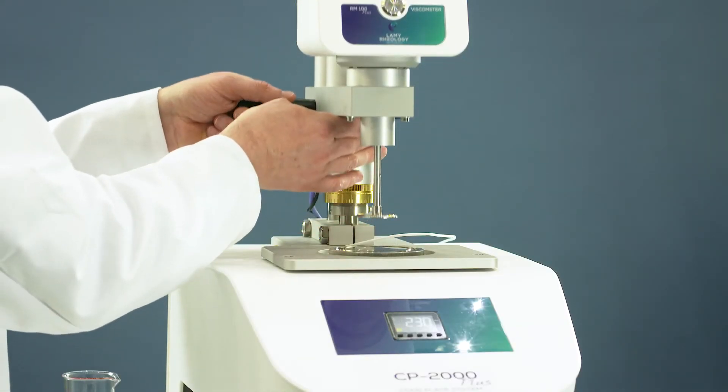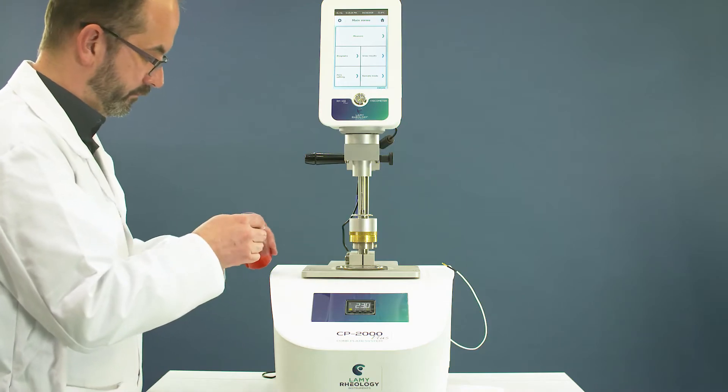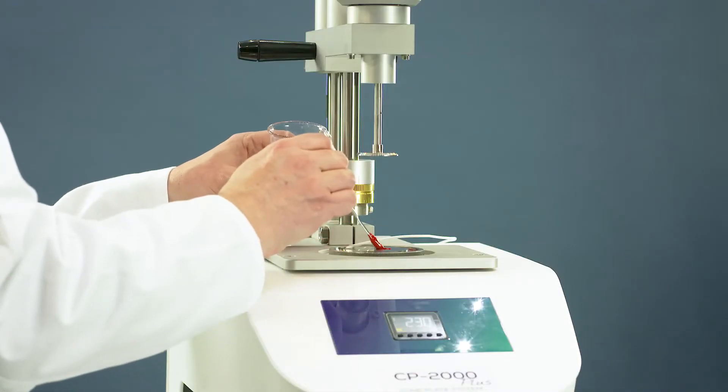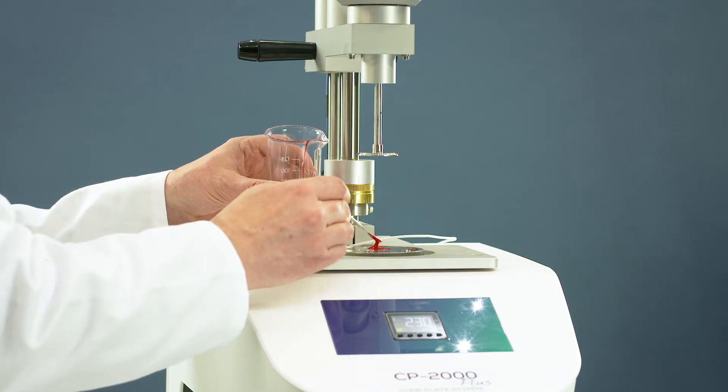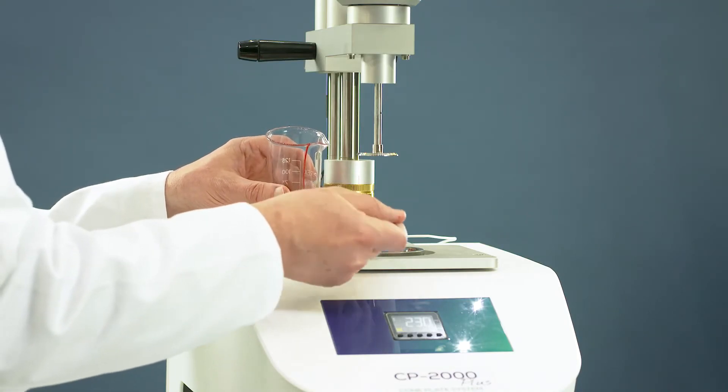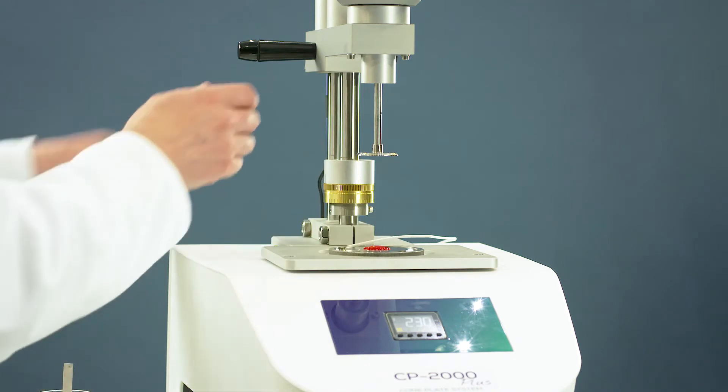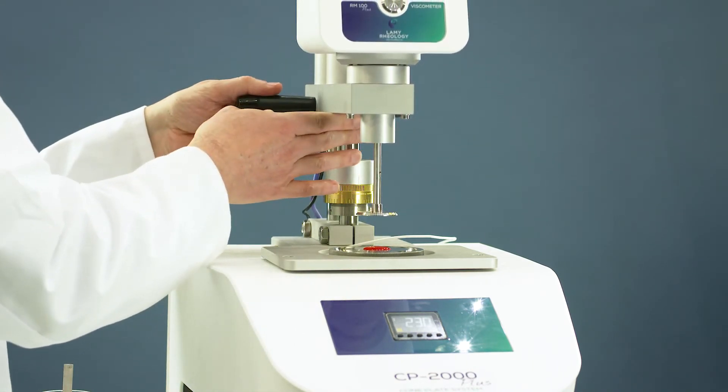Rise the measuring head. Place the sample on the lower plate. Move down the measuring head in the memorized measuring position.